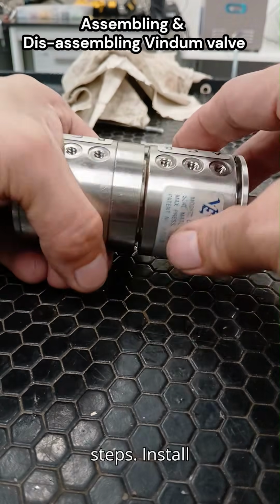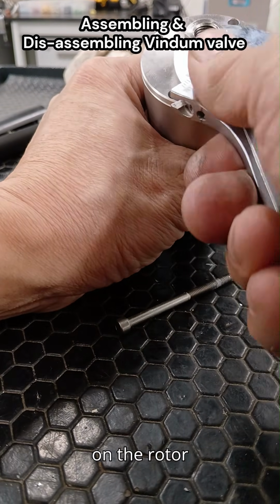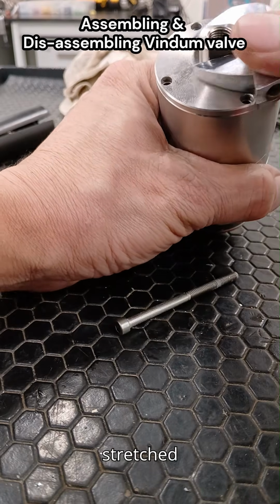Assembly steps. Install seals and O-rings. Lightly lubricate each new O-ring. Seat them in their grooves on the rotor and/or body. Ensure they are not twisted or stretched unevenly.